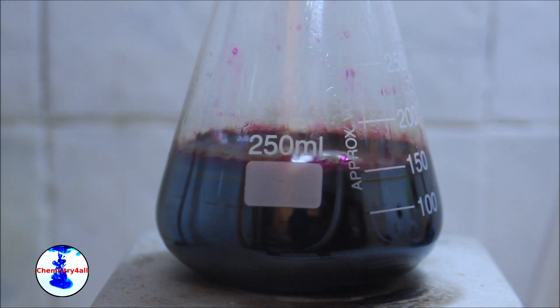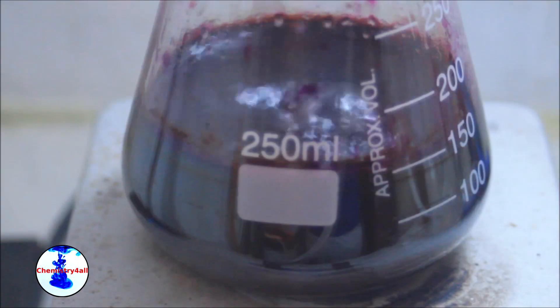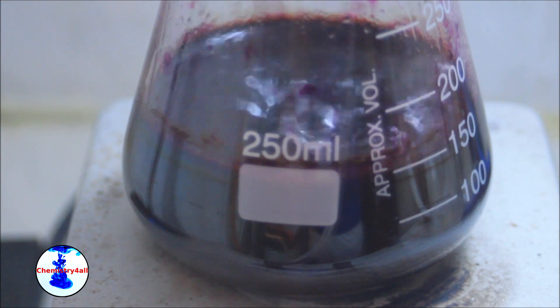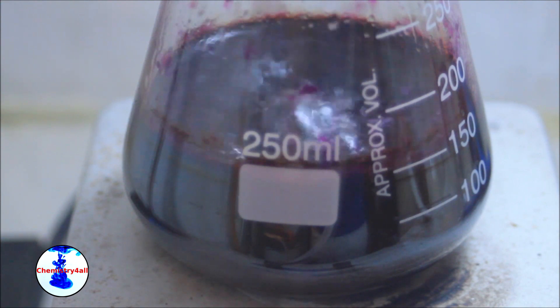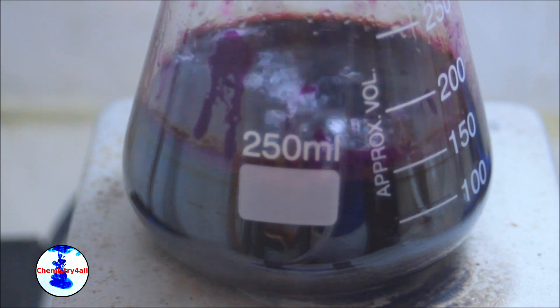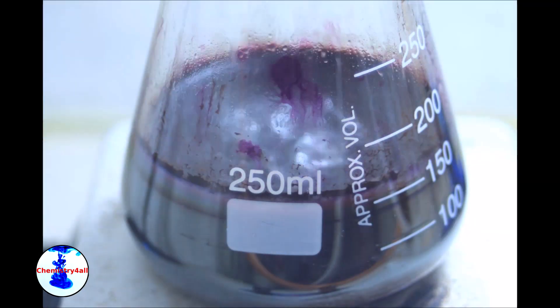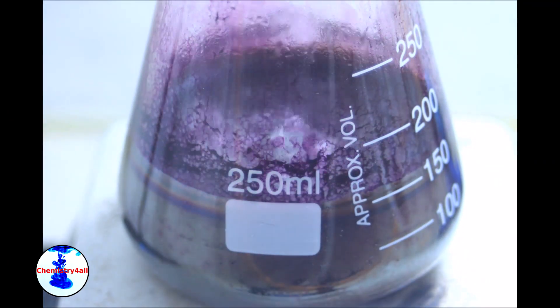Here you have a time lapse of the whole reaction. Notice that as the reaction proceeds the manganese dioxide nanoparticles stick to the walls of the flask creating a nice reflective coating.